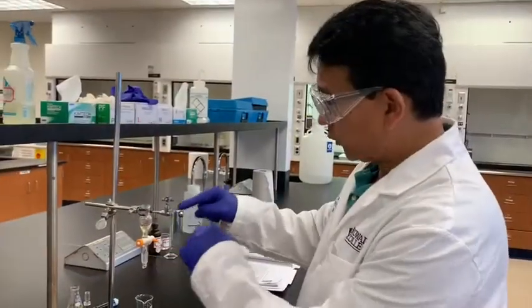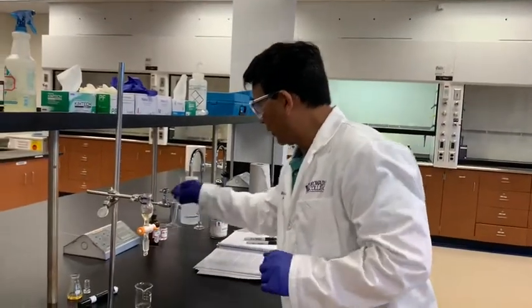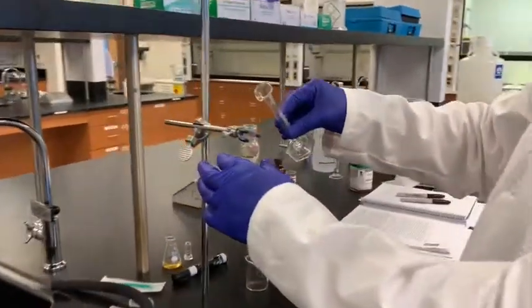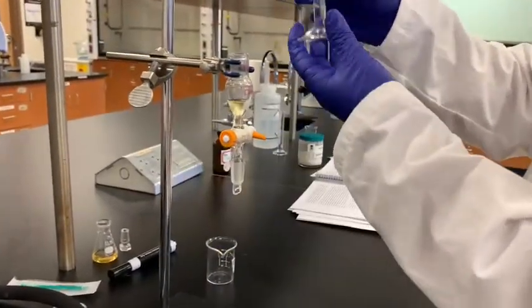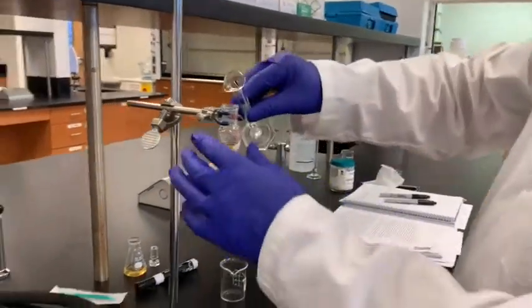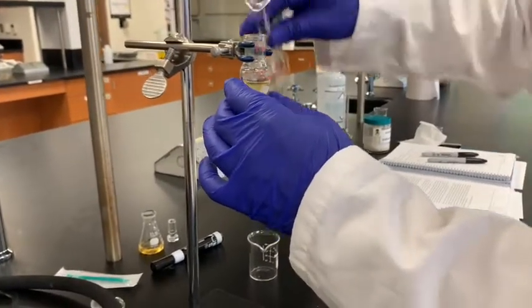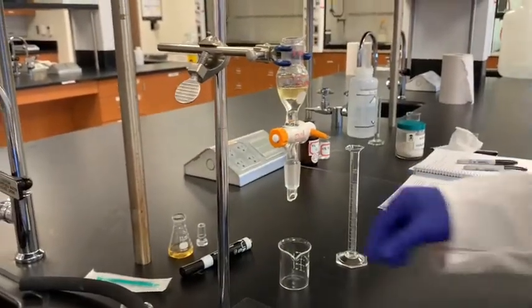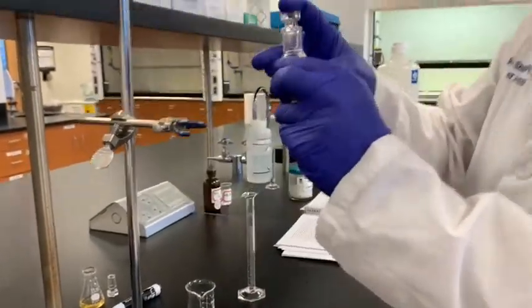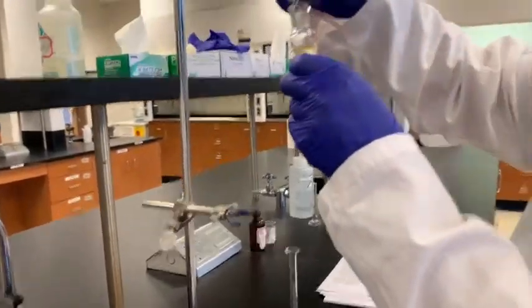Now after sodium hydroxide, this solution, then we will do the extraction with hydrochloric acid, or cleaning with hydrochloric acid, we can say that. So I use 2 milliliter of hydrochloric acid here. That is 10% HCl. So I will just add that into this one. Okay. And do again that same mixing process that as we did earlier. So quickly shake, and we can separate the layer there.